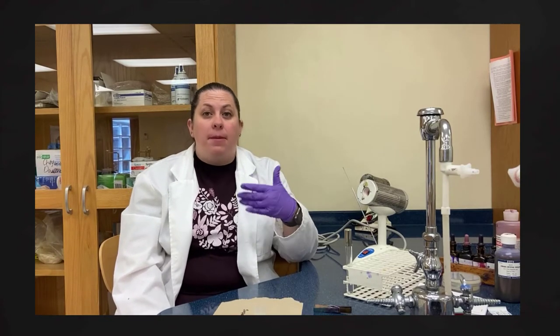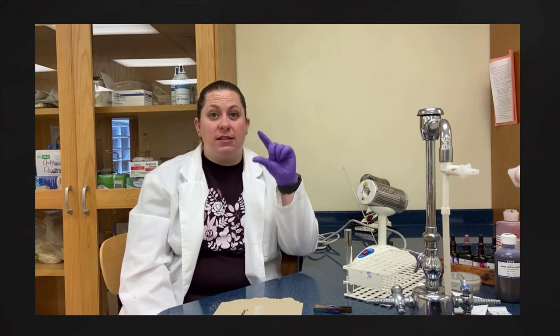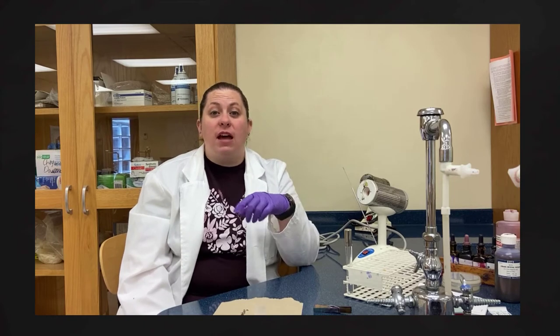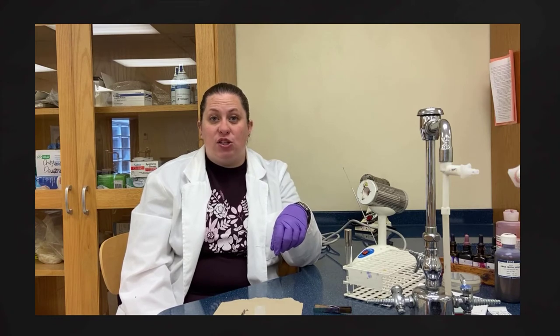With a simple stain, we're going to use just one stain. The point of a simple stain is to allow us to visualize the morphology of the bacteria as well as a little bit of its structure. It's not going to let us differentiate one type of bacteria from another based on chemical components — only shape. It's going to let us see if it's coccus, the round shape; bacillus, like a rod; or spirillum, where it has a spiral structure.